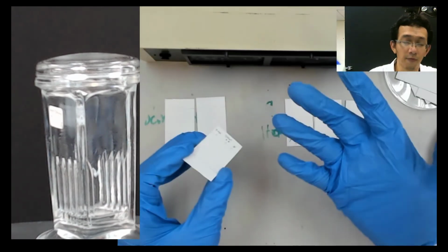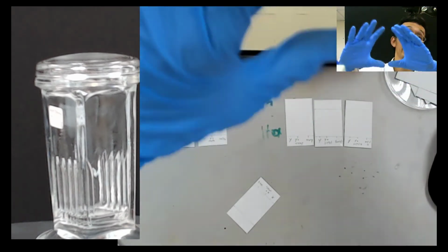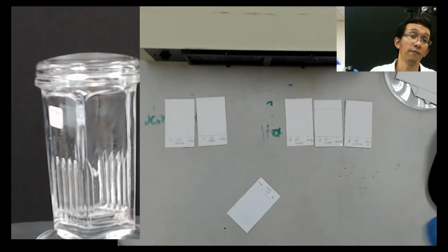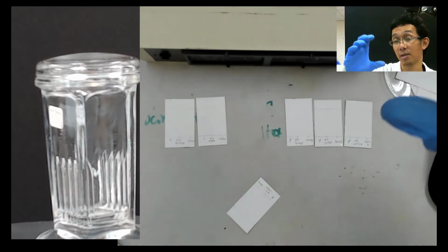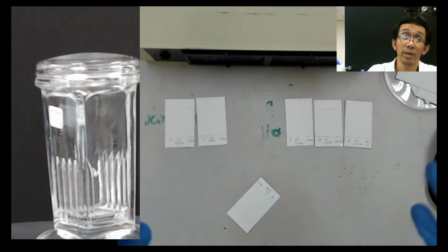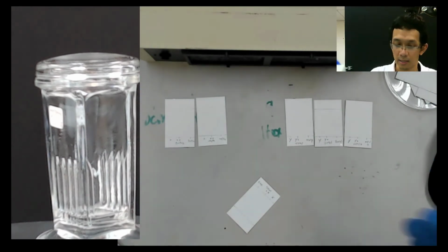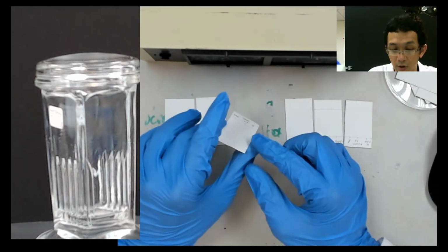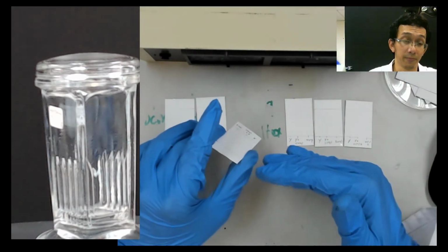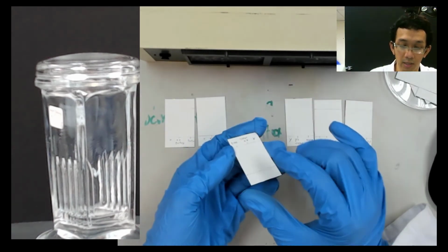If you have an infrared camera in front of me, you can see me glowing, because of heat. So an IR camera can show you your heat, your temperature. We cannot see it now because you are seeing me using normal light. Same here: we cannot see, not because they are not there, but because we are not capable of seeing it. If we use UV light, it gives you some fluorescence.